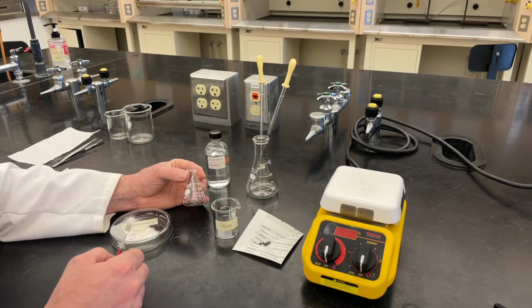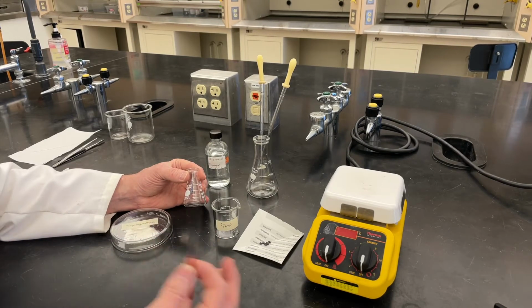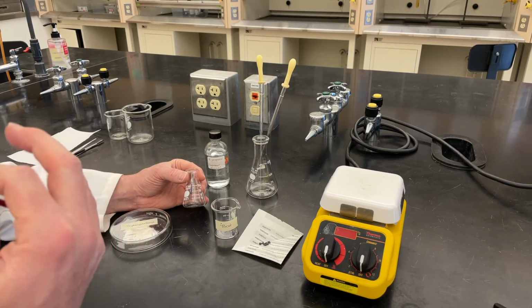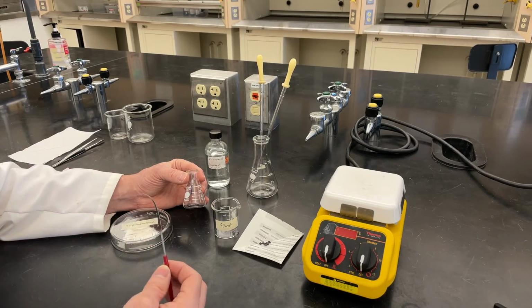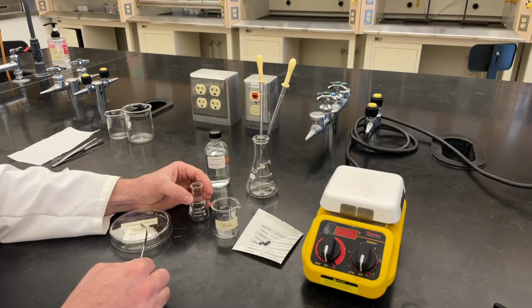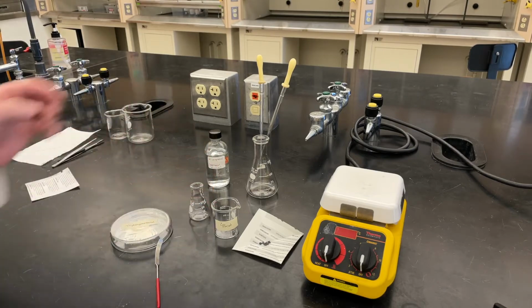We're not going to use all of our triphenylmethanol. We're just going to use a portion of it, in case we make a mistake or something happens, so we have more to recrystallize. If you don't have to, you never really want to commit all of your material to a step, so it's good to retain some. We'll weigh out a portion of this, come back, and set up to do this recrystallization. We'll show you how it all works.